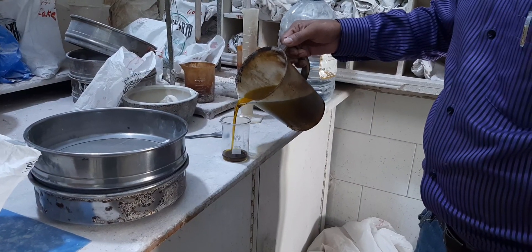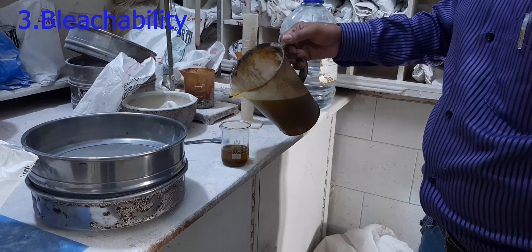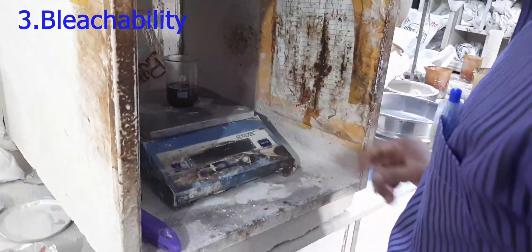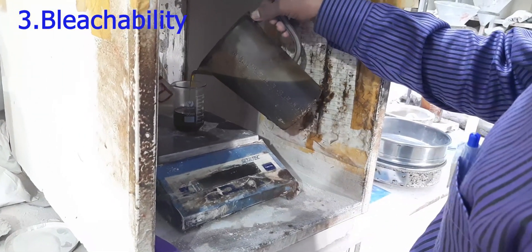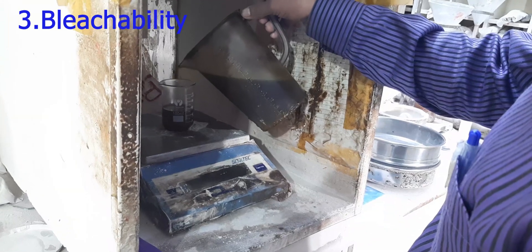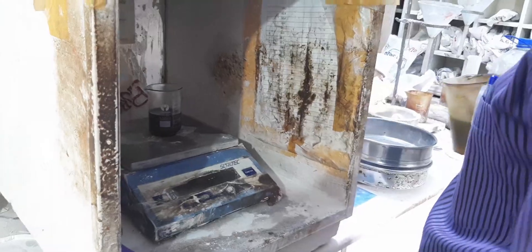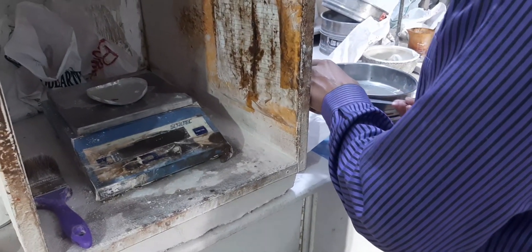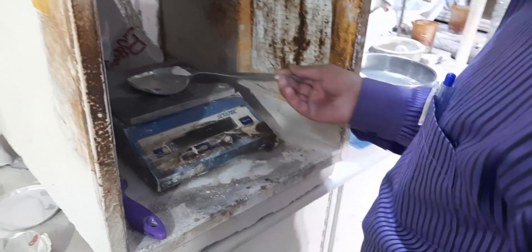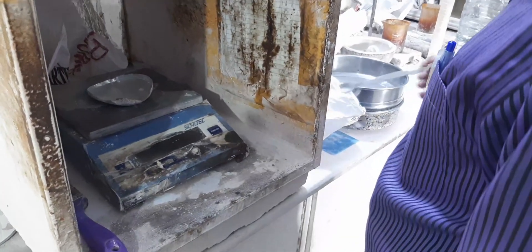We will bleach this black oil using bleaching earth. Take 50 grams of oil. Now we will take 0.5 grams of activated bleaching earth — this makes a one percent dosage.